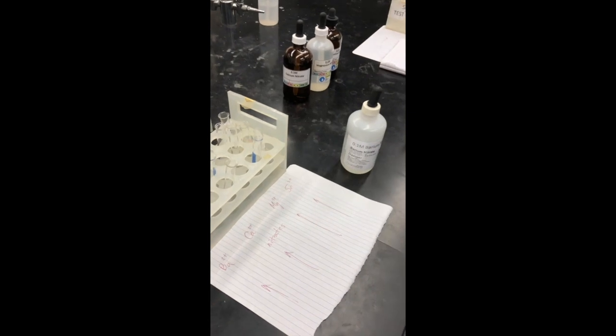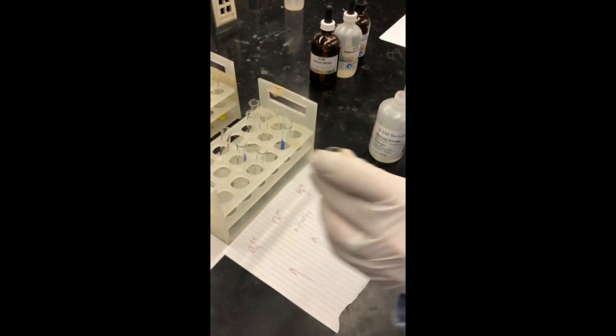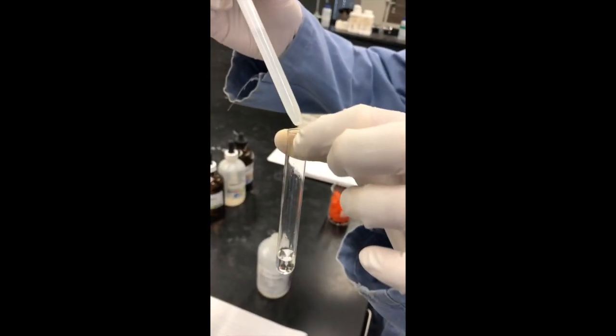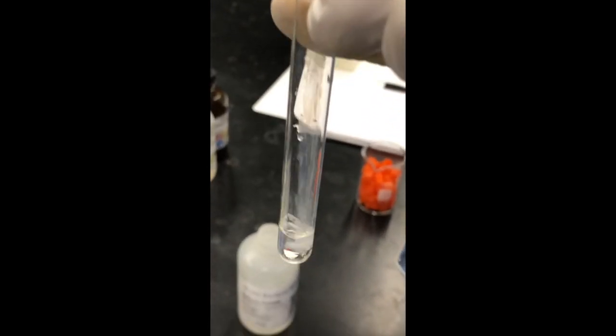Starting first by adding barium ion, we will add barium ion to sulfuric acid to see if a precipitate forms with the sulfate.